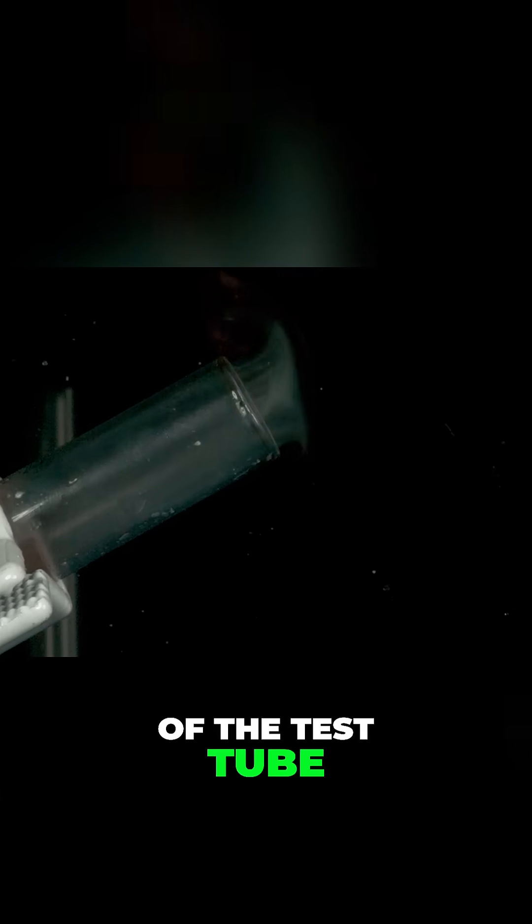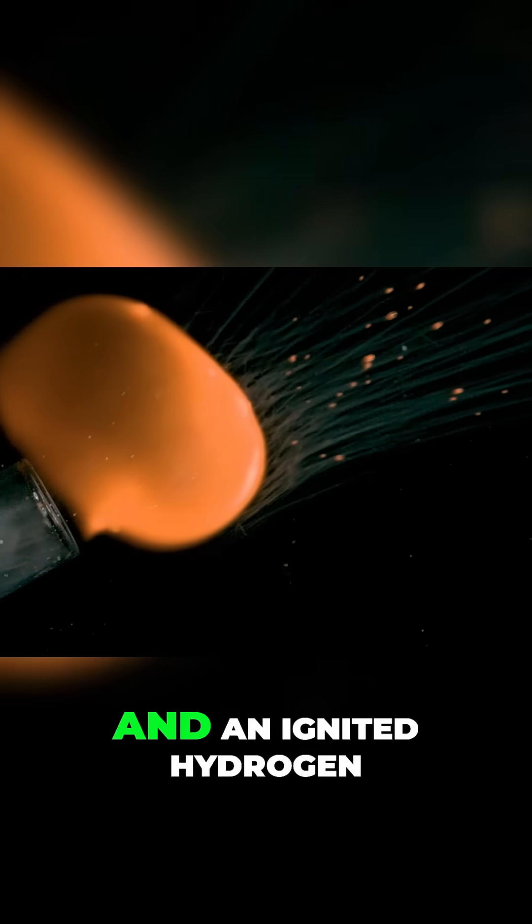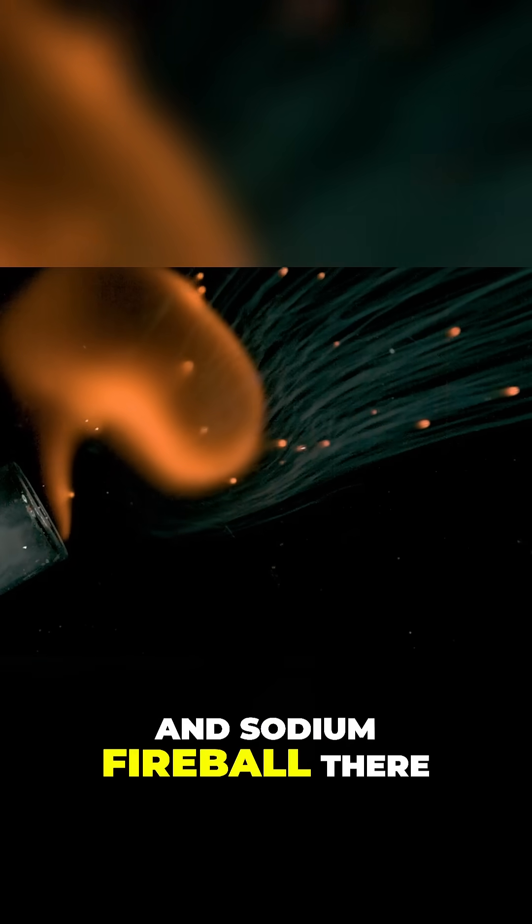to the mouth of the test tube where you can see a shock front, an actual shock front and an ignited hydrogen and sodium fireball there.